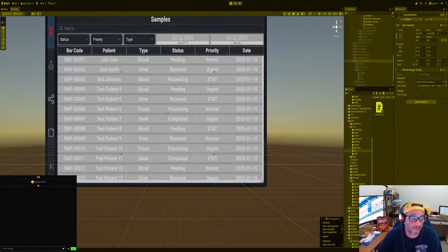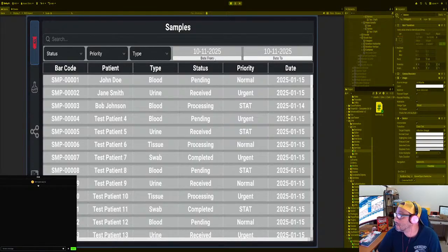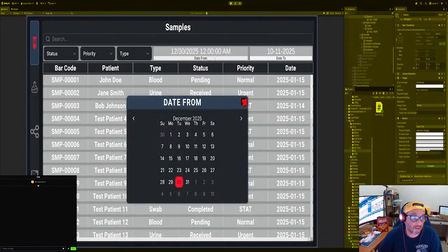All right. So then we click on here. Oh, I'm sorry. Click on here. Can you see the screen? Okay, making sure. All right. Open that up, and then we click on here. You see how the date changes? The date changes, right?